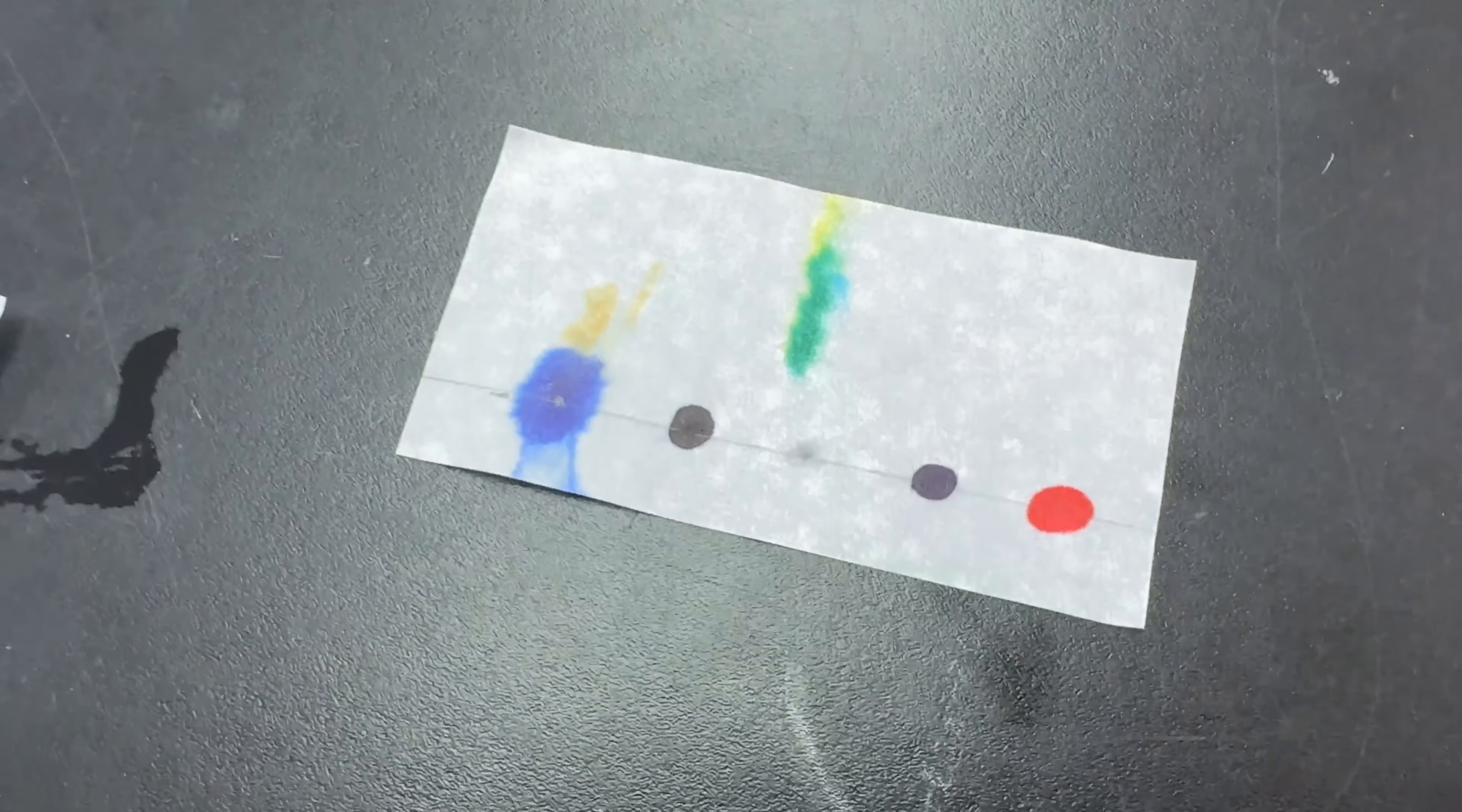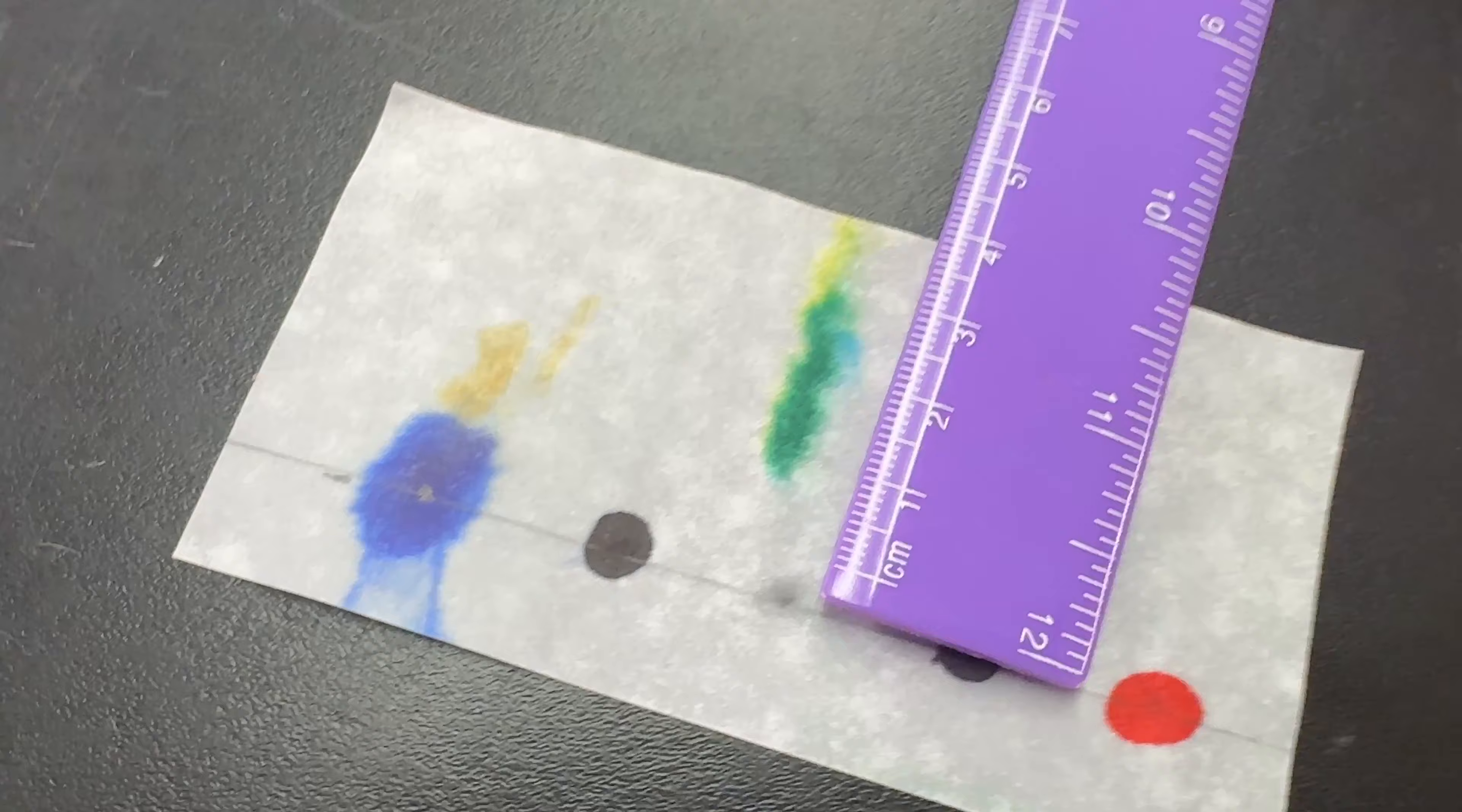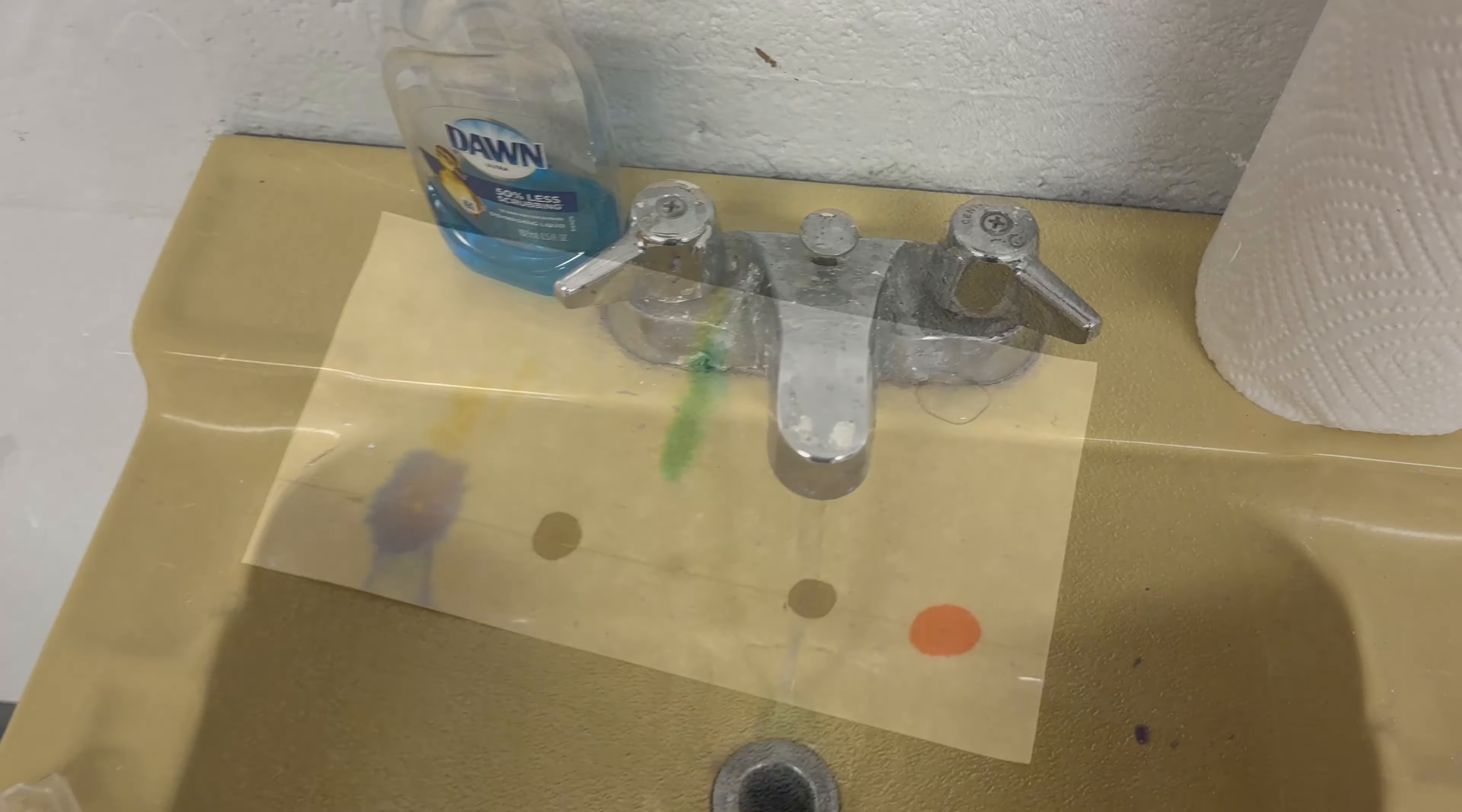Step nine: measure the average distance that each solute traveled and record this in millimeters in the table provided.